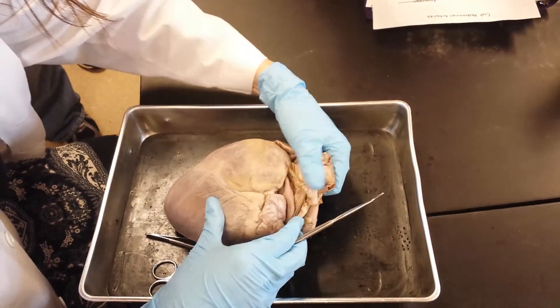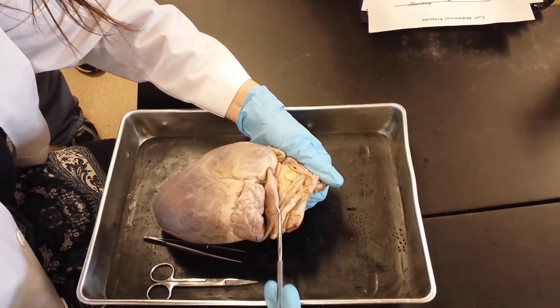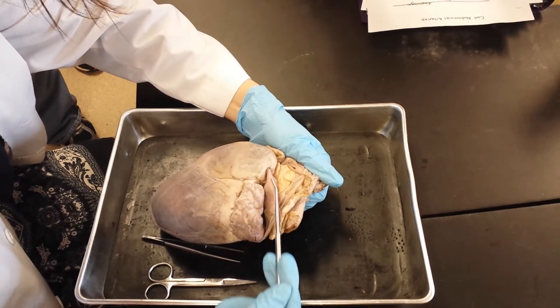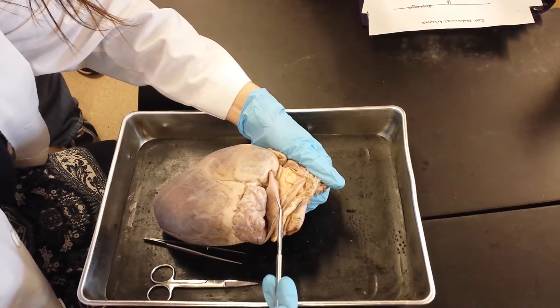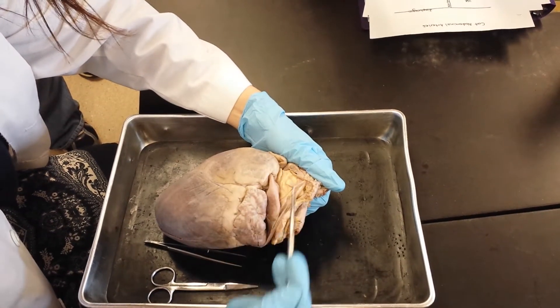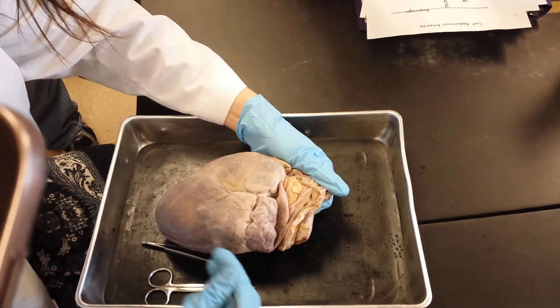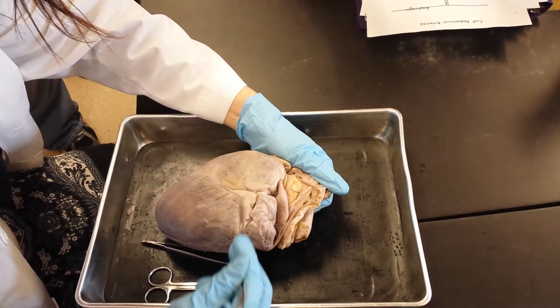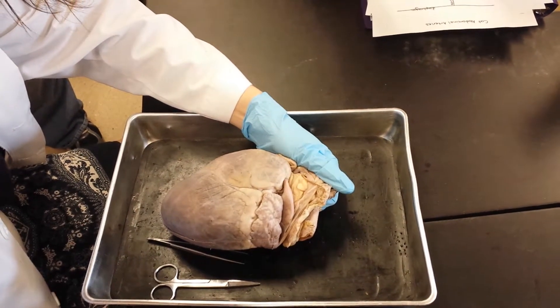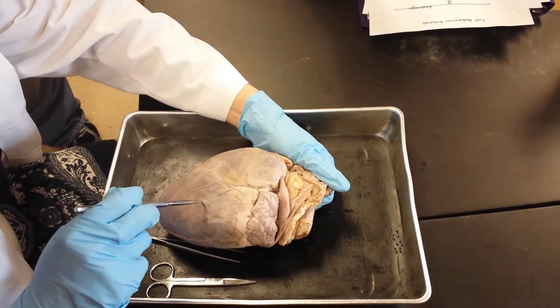Across the front, look for this little finger — that's your pulmonary trunk, and that's going to branch into the pulmonary arteries, which are going to go out to each one. This little shiny membrane on the outside is the epicardium, also known as the visceral pericardium. I'll take either answer on the exam.